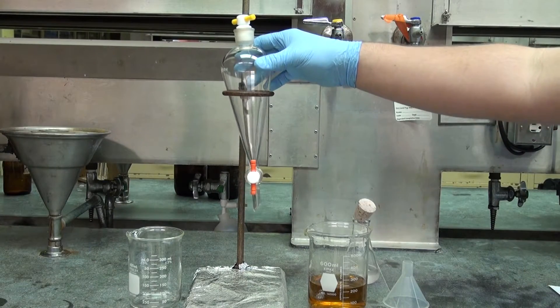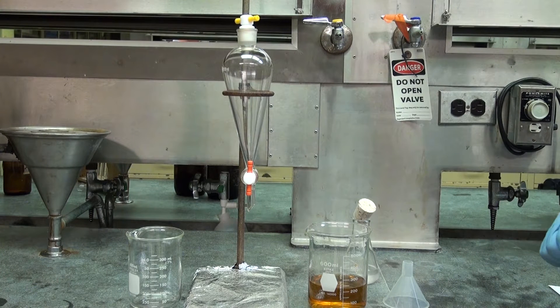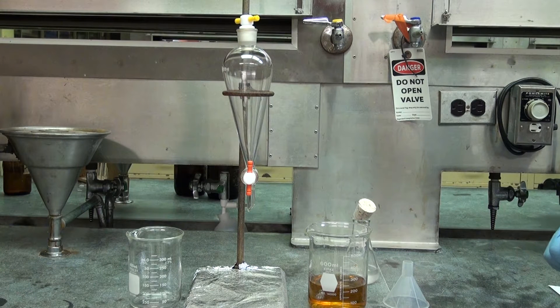How to use a separatory funnel: This is a separatory funnel with which you can perform a liquid-liquid extraction.